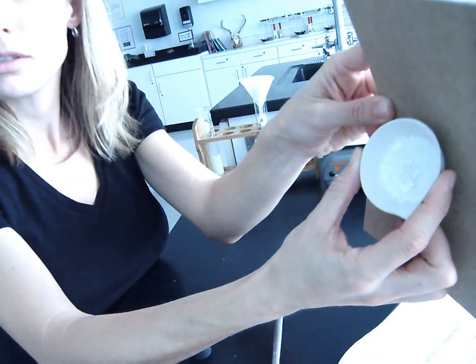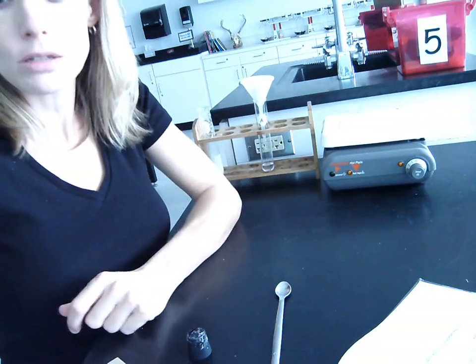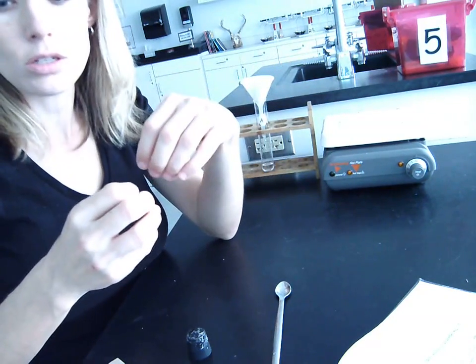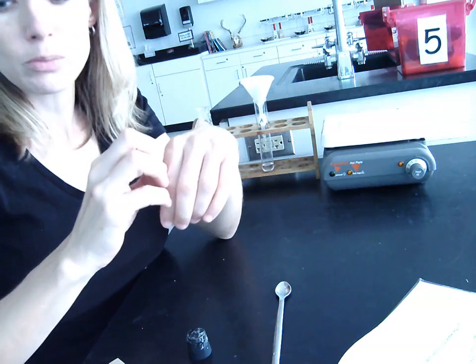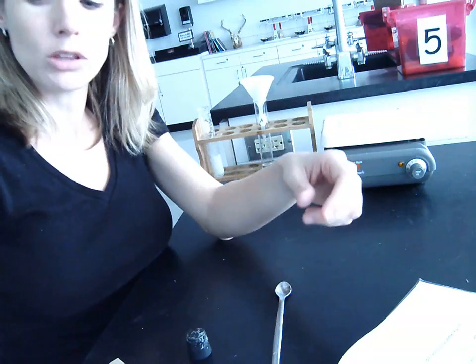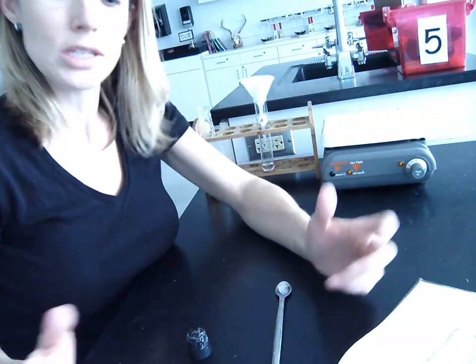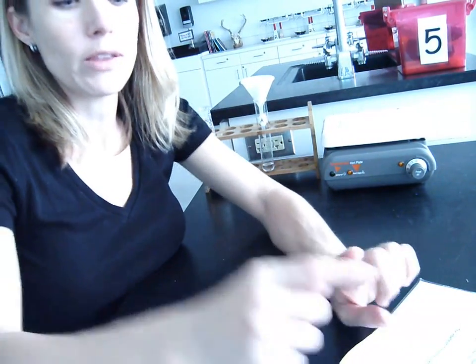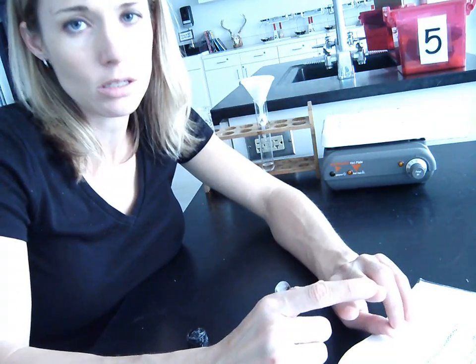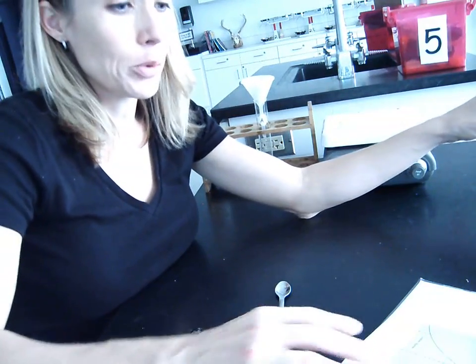So there's the salt, and you just saw the sulfur on the filter paper, and we've separated them based on filtration. So here they were originally, mixed together. We put some in water, the salt dissolves in the water, we filter that through the filter paper, the sulfur stays in the filter paper while the salt water goes through, then we evaporate the water from the salt water, and we're left with the salt, and then we have our sulfur and our salt totally separate. That is lab 5.4, and that's based on the fact that one of the substances dissolves in water and one does not. So that's that method. And let's go back to 5.6 now.